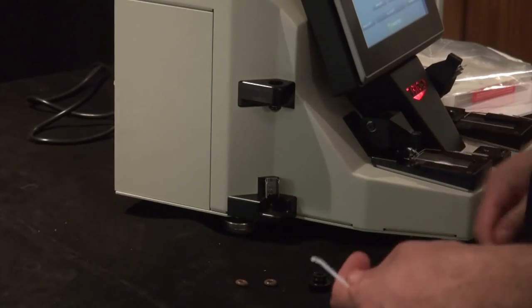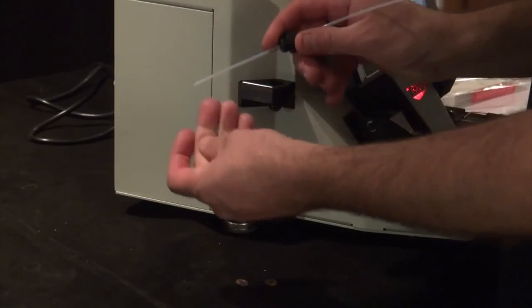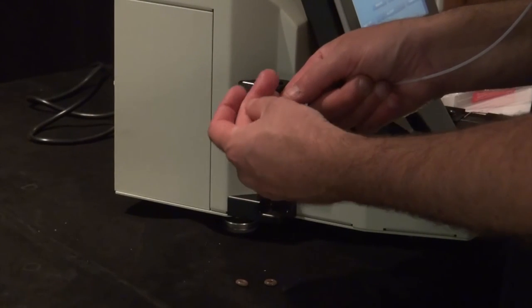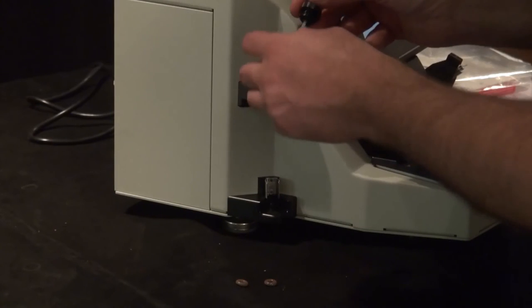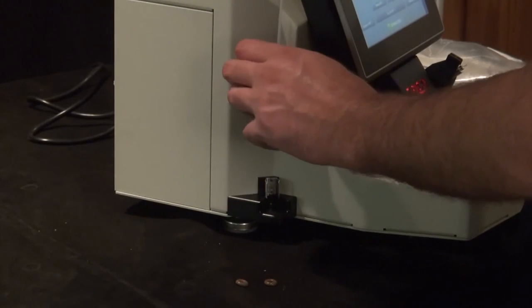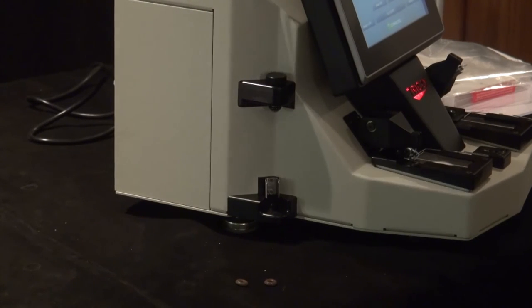If you want to replace it, the easiest way to do that is to take your sample tube and put it through the top cap, and take your O-ring and put it on the end to keep it in place so it's not moving around when you put it in. Then all you have to do is insert the tube in and tighten it down. And now it'll keep the O-ring in the groove.